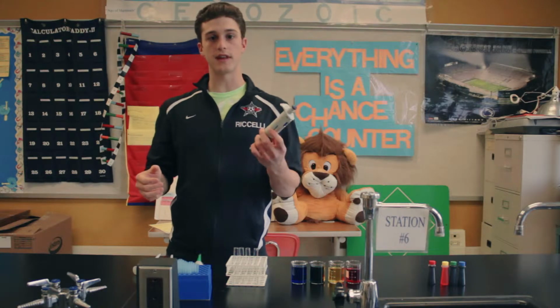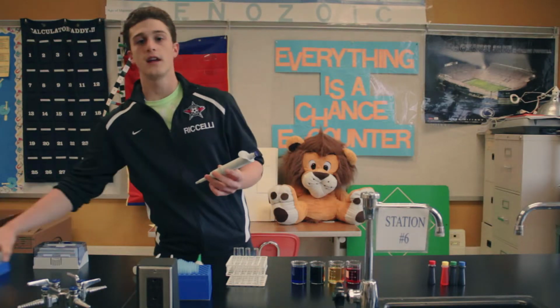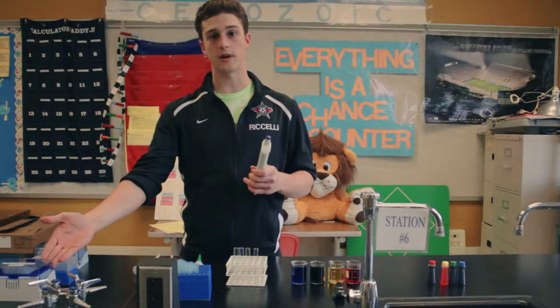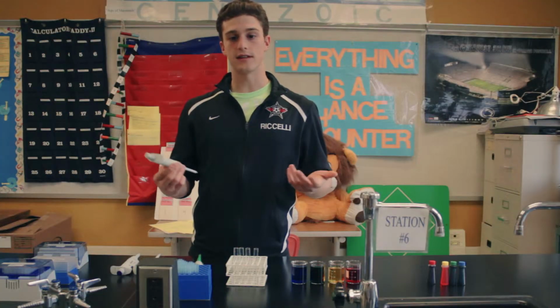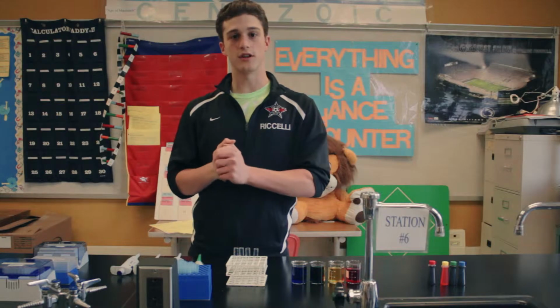Same basically with the Eppendorfs, except they're special. So each Eppendorf is going to have its own tip. For the 1,000, there's 1,000 microliter tips, and same for the 100 and the P10. So that's basically the parts of a micropipetter, and Maggie's going to show you a demo.